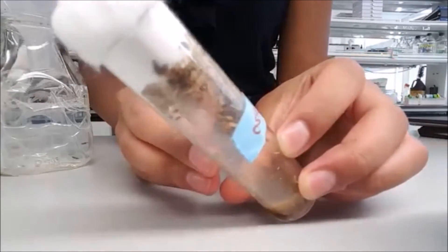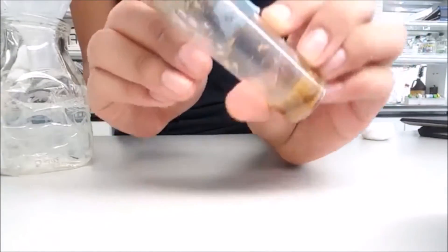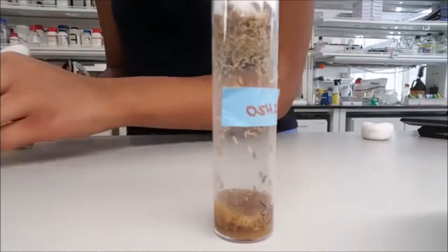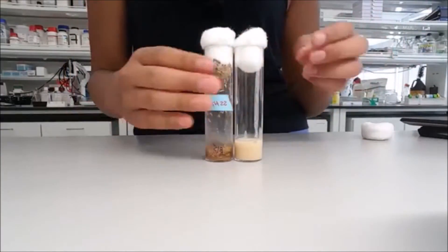This vial has pupae that have eclosed — you can see these black dots, which are adults ready to come out, and these empty shells are adults that have already eclosed. We have enough adults, so we're going to flip them into our food vial because it's unhealthy for them to continue living in the old food.